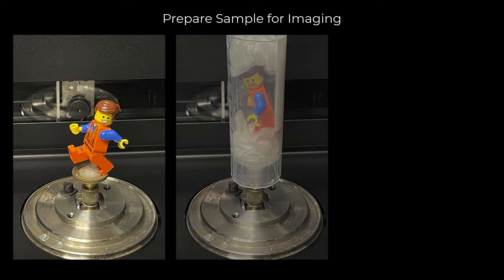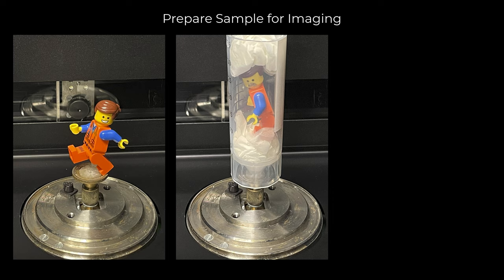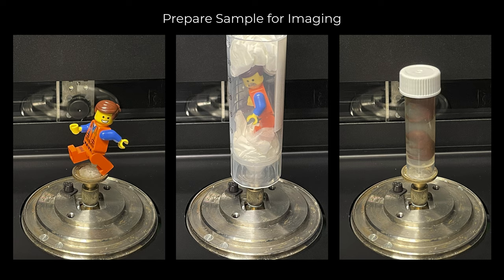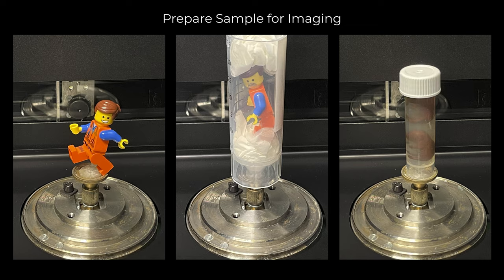Here are some recommendations for sample preparation before setting up your sample for imaging. For objects that can be imaged directly in air, they can be either mounted directly on the brass sample holder or placed in a sample tube with Kimwipes to prevent sample movement during image acquisition. For samples that require staying hydrated during acquisition, they can be mounted in a sample tube with 1% agarose. This will not only help to prevent sample dehydration but will also prevent sample movement. Please discuss with OIVM staff regarding your sample type and mounting methods prior to your image training session.